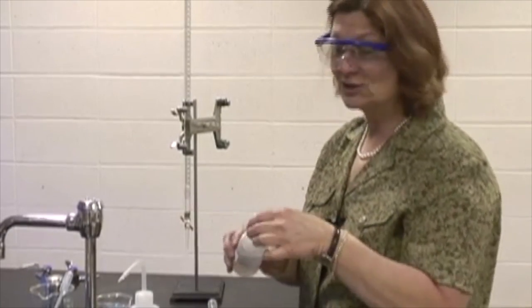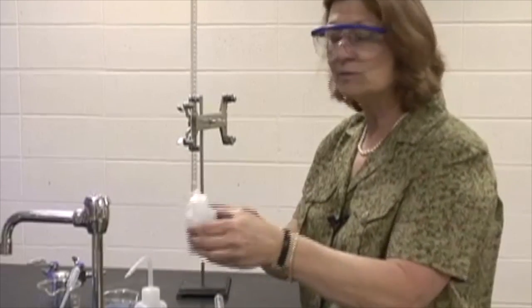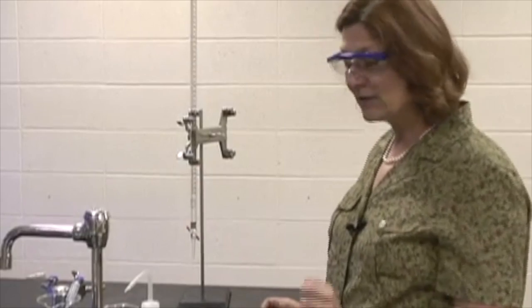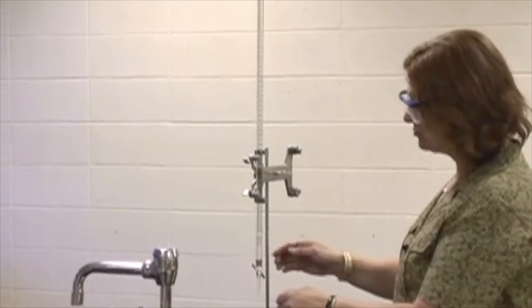I'm not looking for the concentration, I'm looking for the moles, excuse me, not molarity. And the magic ingredient is my phenolphthalein indicator, which I use approximately 3 drops. As long as some of it is in there, that is fine. Now, I'm going to go ahead and titrate.